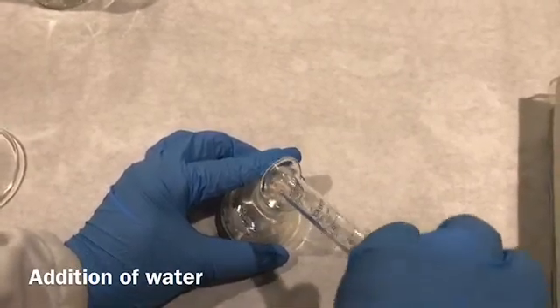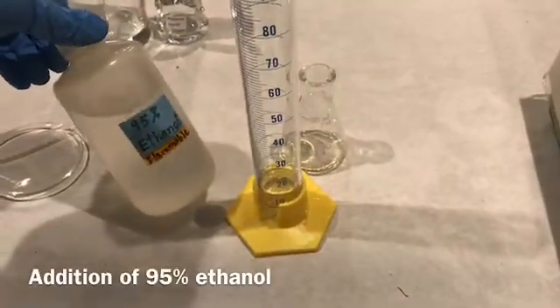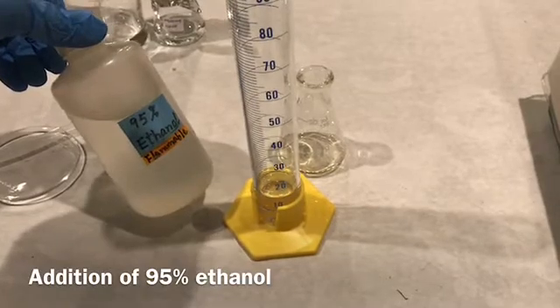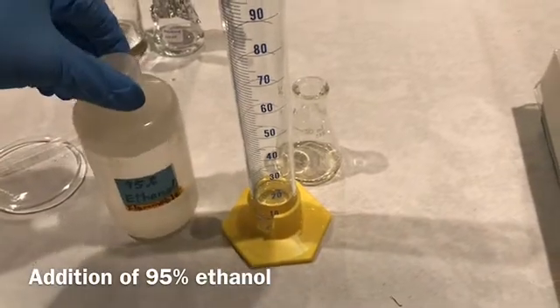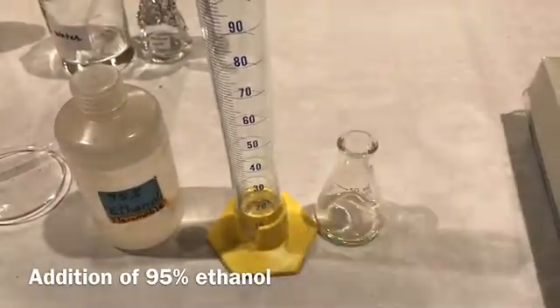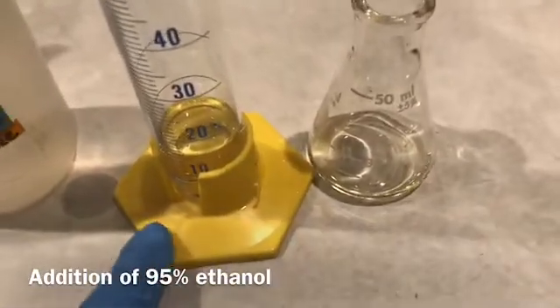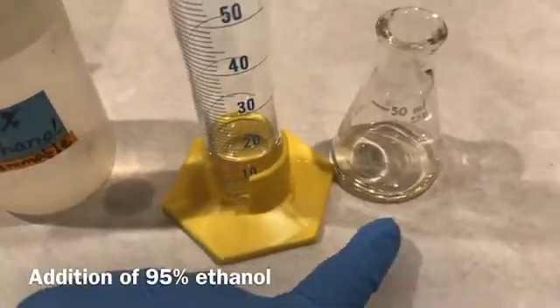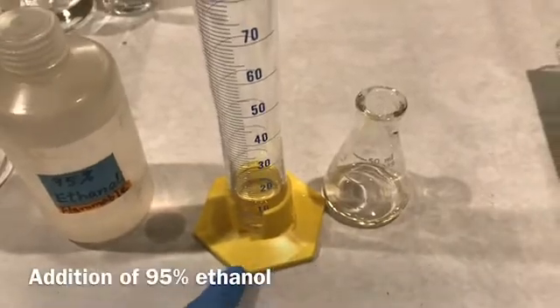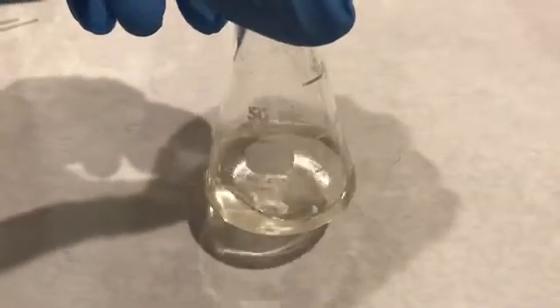Now I am going to transfer 15 milliliters of 95% ethanol to the Erlenmeyer flask. You can see that the thiamine hydrochloride is already dissolved in the 2 milliliters of water. I will swirl it until it becomes a homogeneous solution. Now it is completely dissolved — you can see this is a homogeneous mixture.